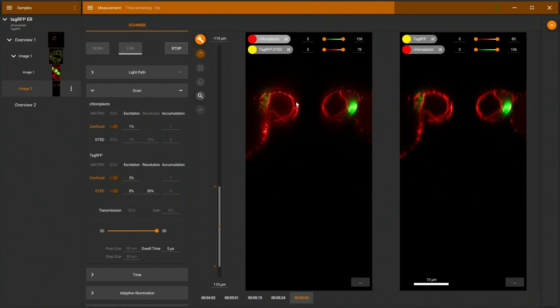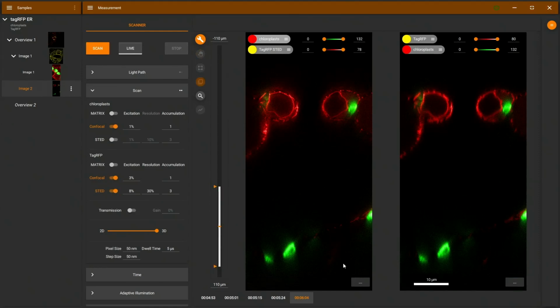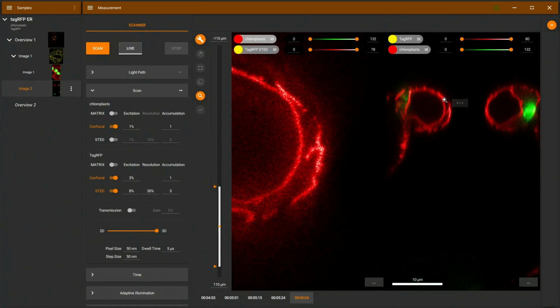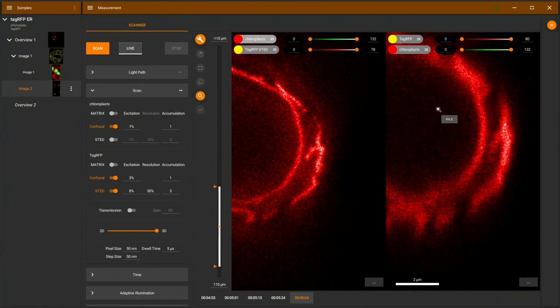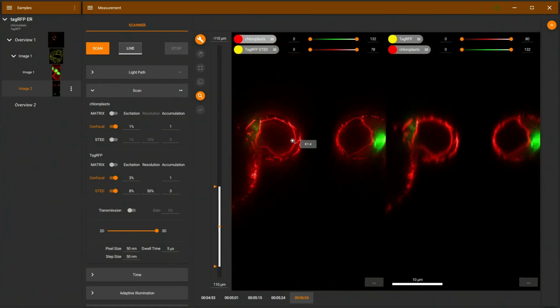But we'll also see if this is working further down in the sample. So there we can also see sharper structures here on the bottom, deeper into the leaf with 3D STED compared to the normal confocal image on the right. I can also use here a zoom tool to look at these things in more detail there. I can zoom in a little bit and also in the confocal image. And we can see that things which appear here as one large blob will be multiple structures in the STED image.